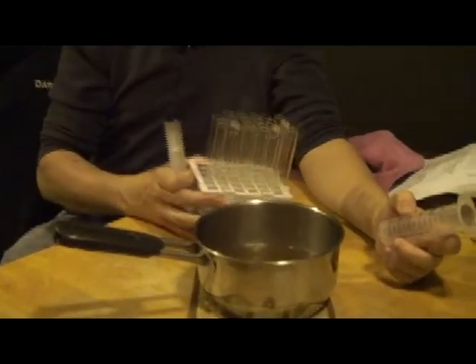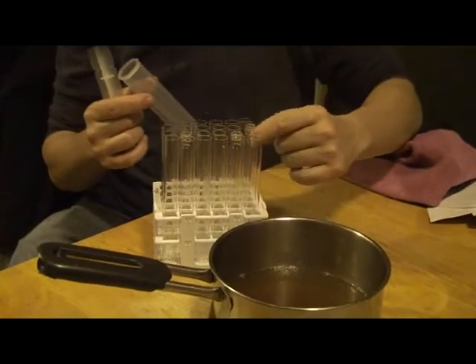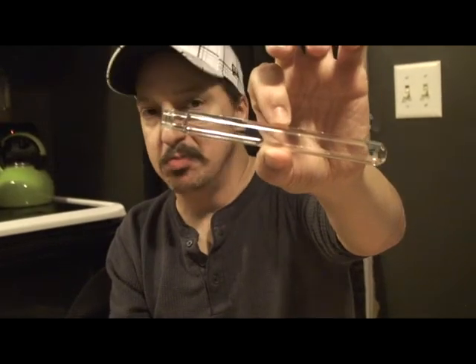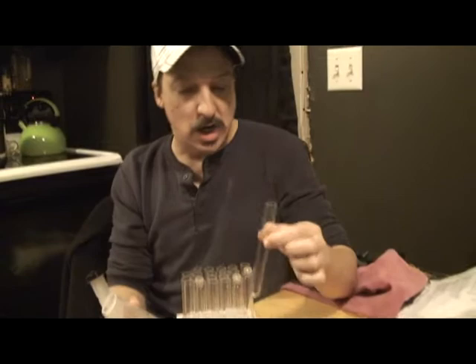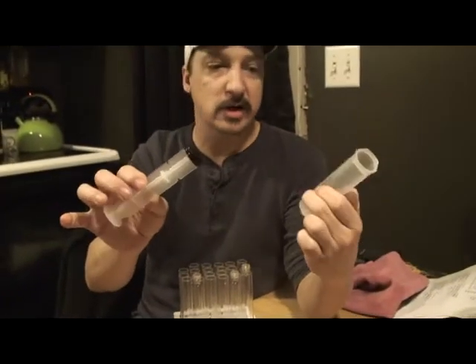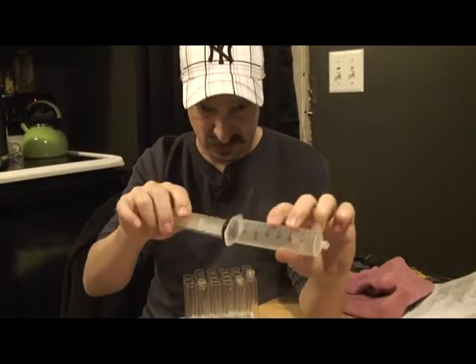Basically what I have is a selection of clean test tubes. I prefer the test tubes with the threads on them — they're easier, they're better, the tops don't pop off when you're fermenting. But I also have a selection of these that I got free from work — beggars can't be choosers, they were throwing them out. This is just a standard 60 milliliter syringe; you can get these pretty much anywhere.